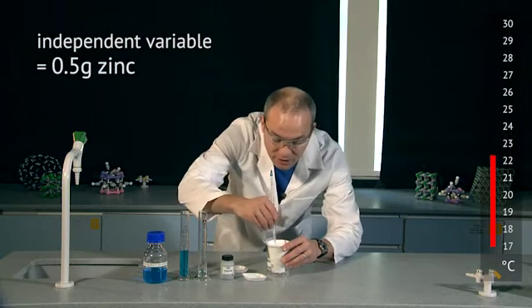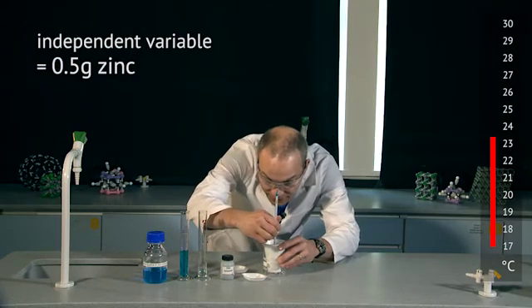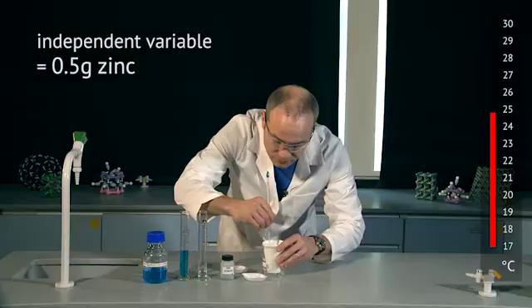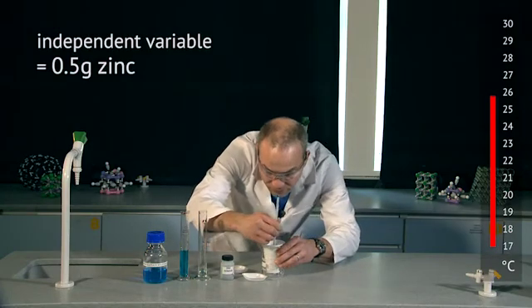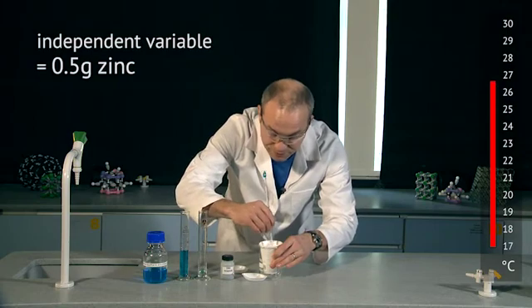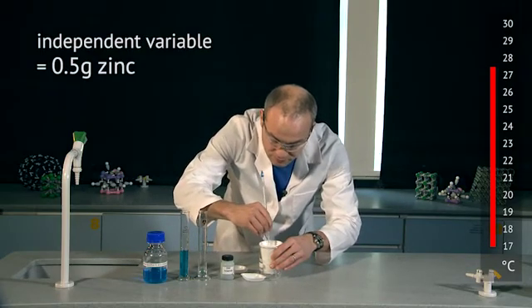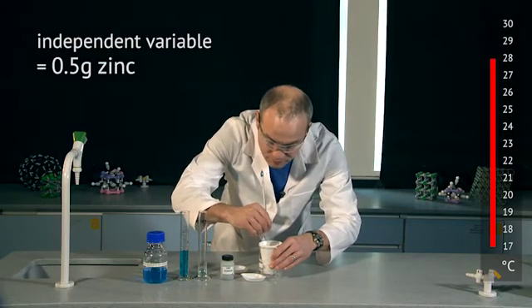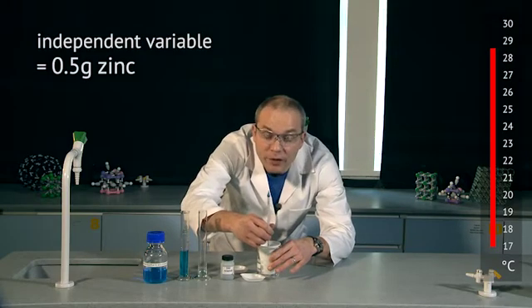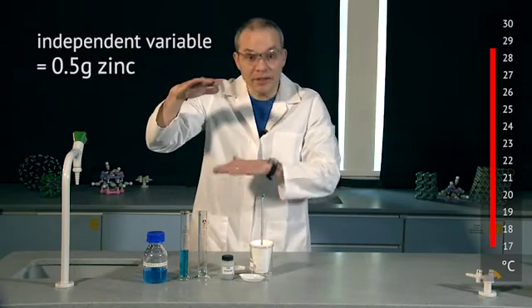The temperature has gone up to 22 but it's still rising, so I'm going to keep stirring and carefully watch for that maximum temperature rise. It's now at 23.5... 26 and still rising, so I need to keep stirring — we're looking for the maximum temperature rise. It looks like it has stopped at 28.5 degrees, so I'd record that as my maximum temperature. I can work out the temperature change from the difference between the initial and final temperatures.